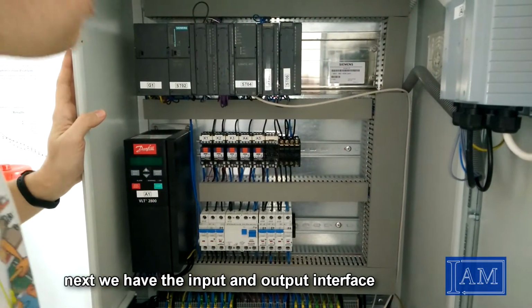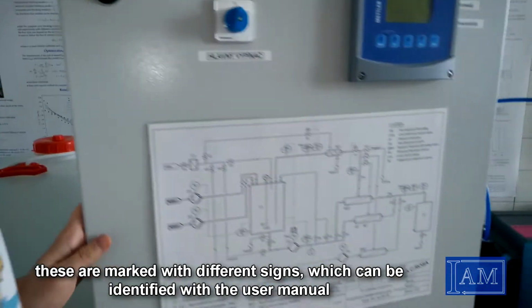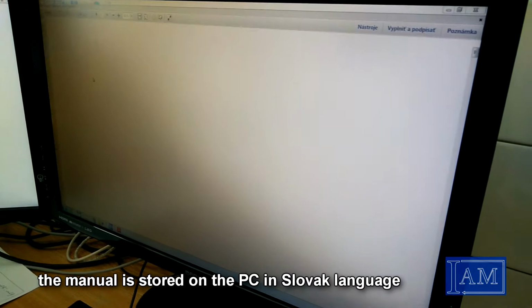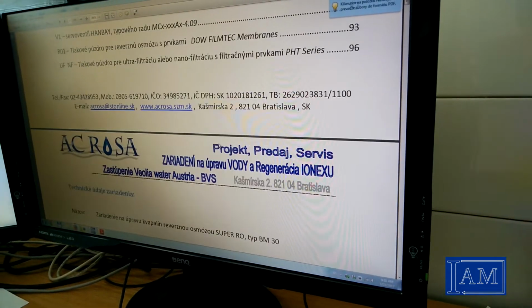Next we have the input and output interface. These are marked with different signs. These can be identified with the user manual. This is the manual which is stored on the PC, and it's in Slovak language.